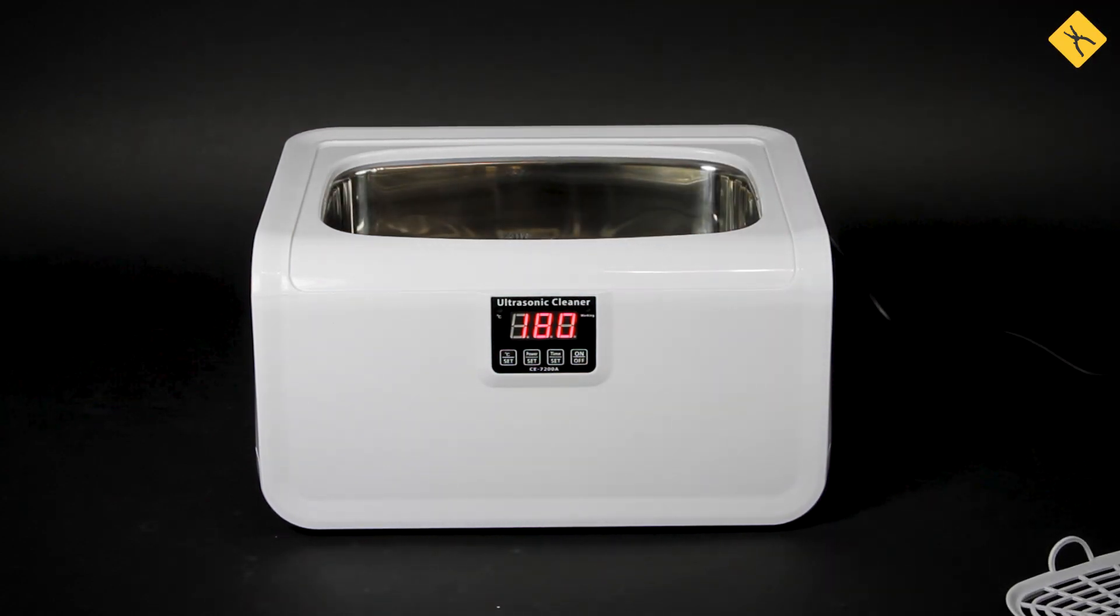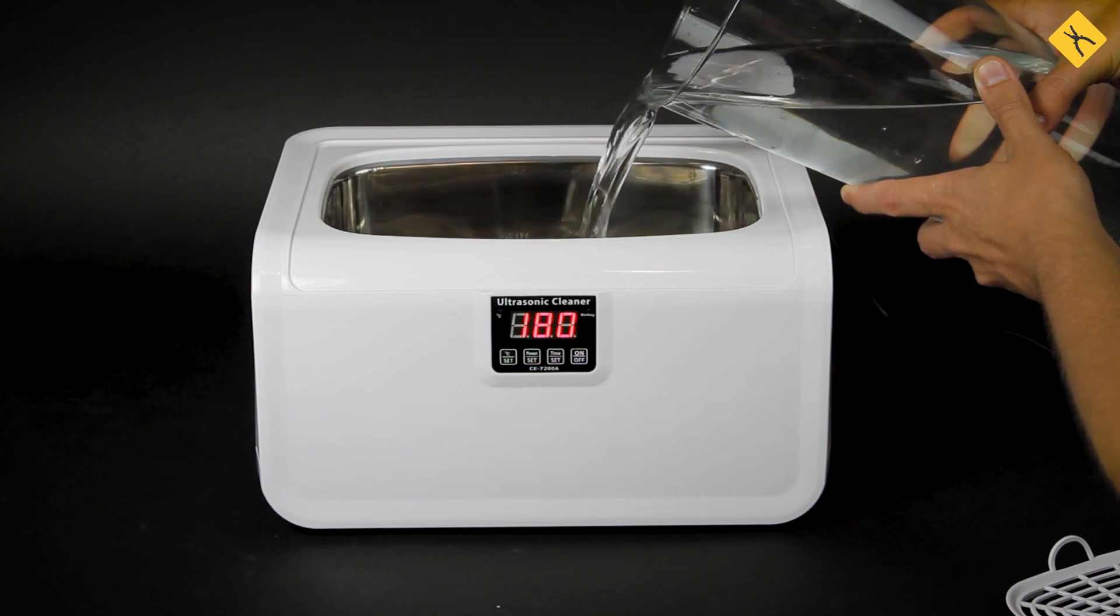Well, very easy. You can perform a simple foil test. Fill up the tank with water.